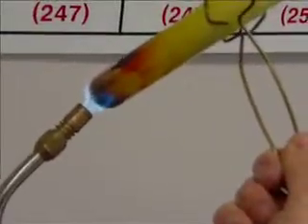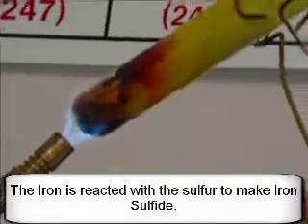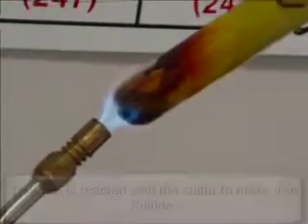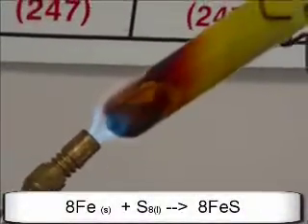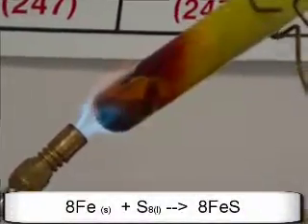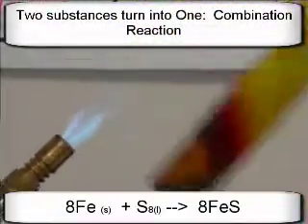Ooh, that's pretty. Red. Yeah, that smells. How long, Mr. Sams, do you think? Are we good? Oh, I don't know. It's looking pretty reacted to me. There's still a little bit of sulfur at the top, but I think we're good. All right.